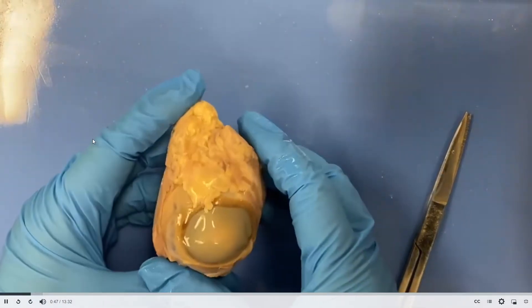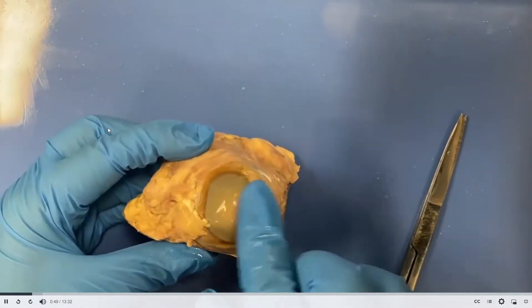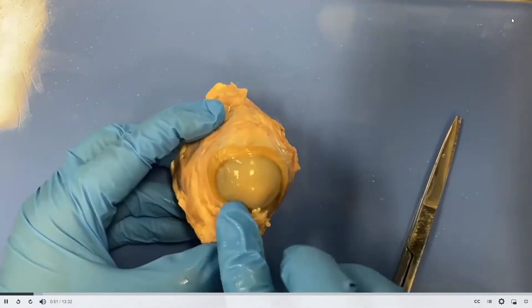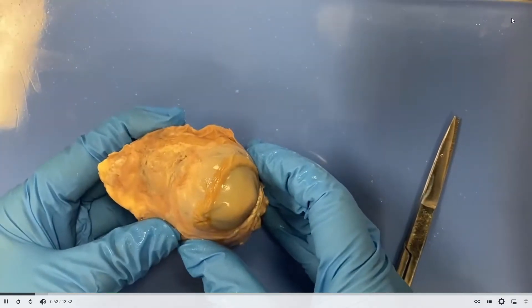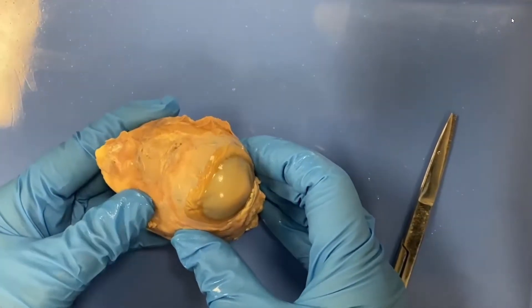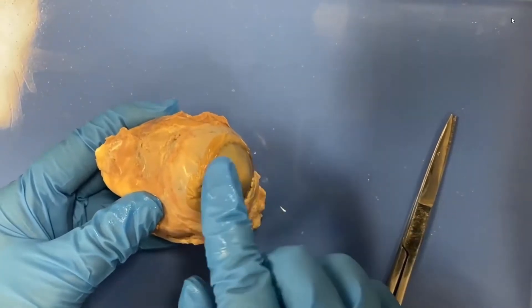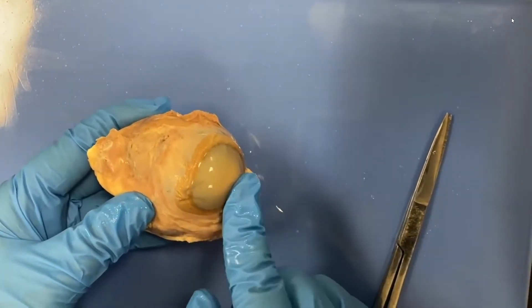If we look here, we have an eye, and you can see the glistening part on the top. So this is the anterior. Every time you dissect, remember this is anatomy — you have to orient yourself. The anterior is going to be here where the cornea is.